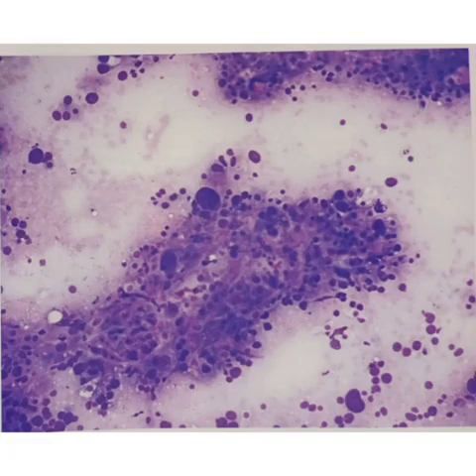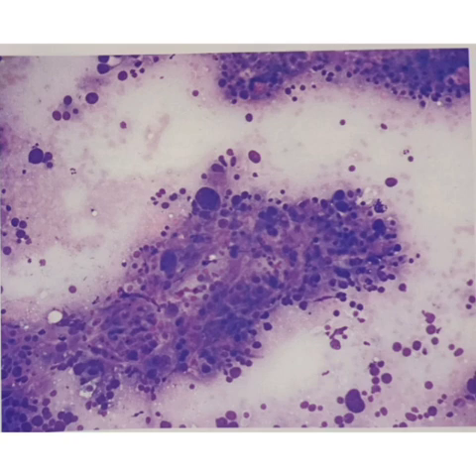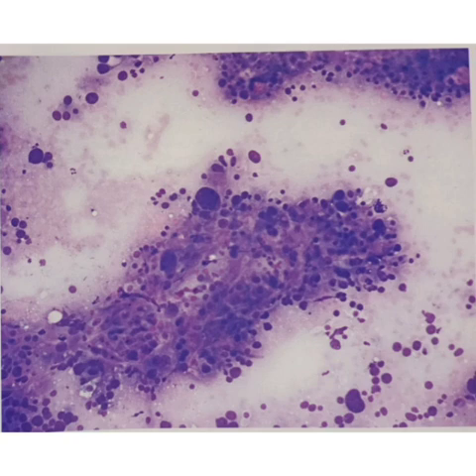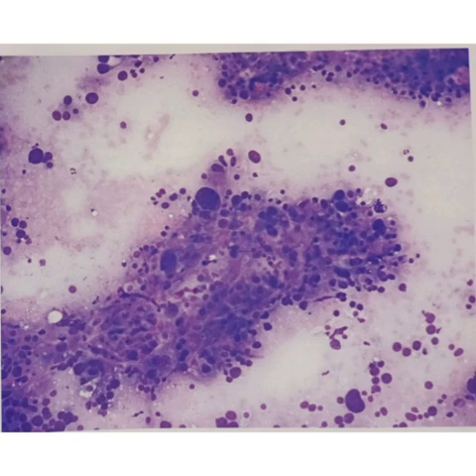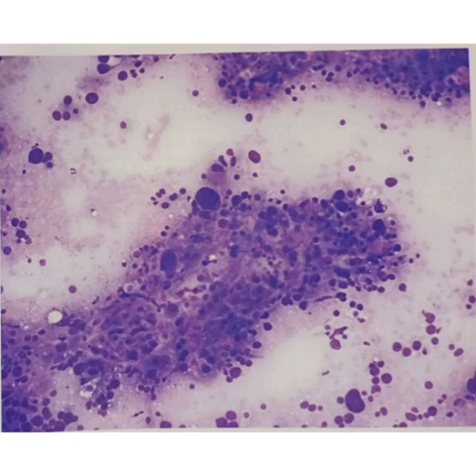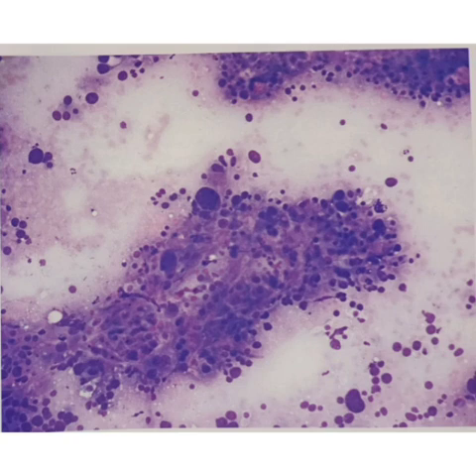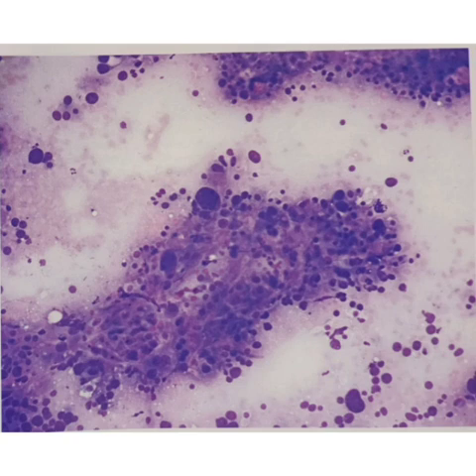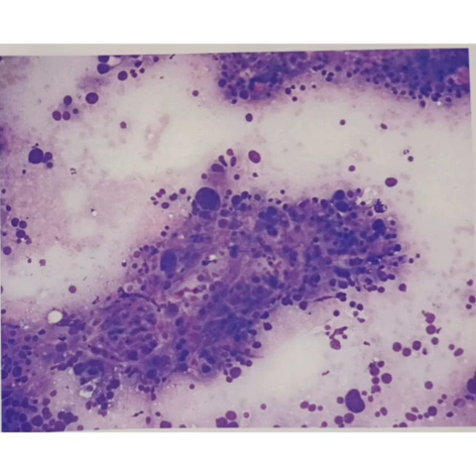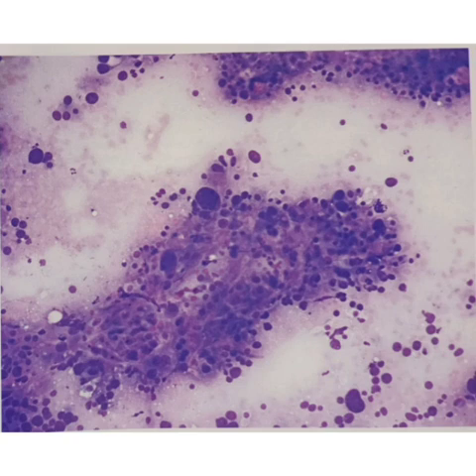This is another image showing sheets of pleomorphic tumor cells. You can appreciate the pleomorphic tumor cells arranged in sheets with loosely cohesive clusters and dark hyperchromatic nuclei.